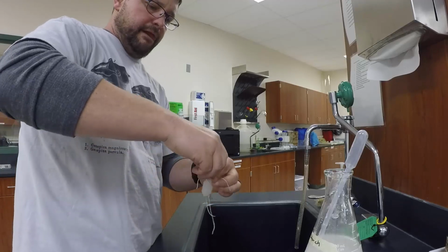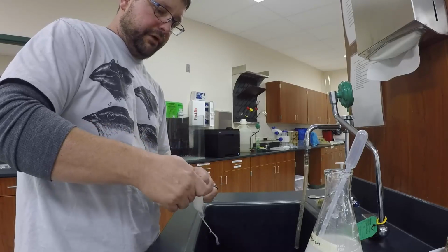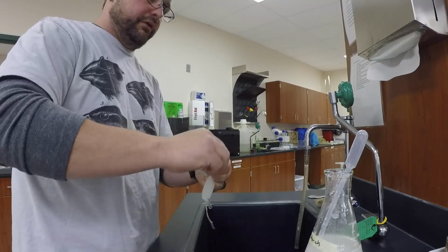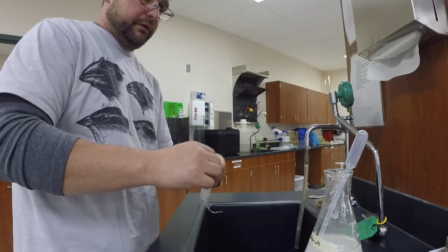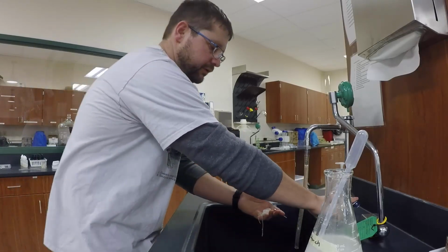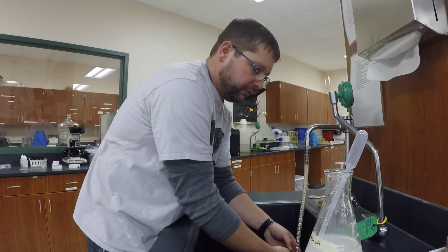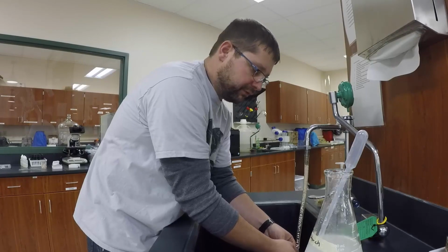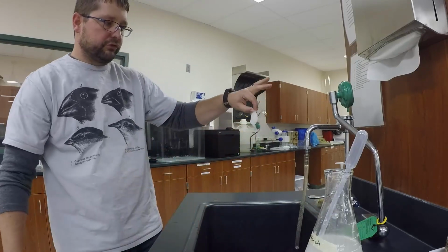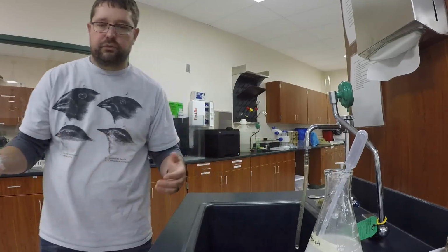So, do a couple of simple overhand knots, get it pretty tight. Now occasionally when you do this, dialysis tubing will rip or break, so we'll see what happens. Hopefully my dialysis tubing is fresh enough and good enough that this will work the first time, so this is not a really long video and I don't have to keep making it over and over again. But I'm just going to rinse that dialysis tubing off so there's no starch on the outside, so we don't get an incomplete reaction or a really fast reaction.